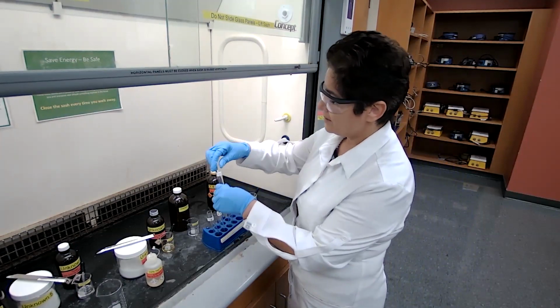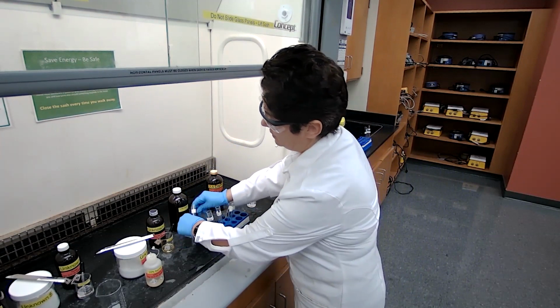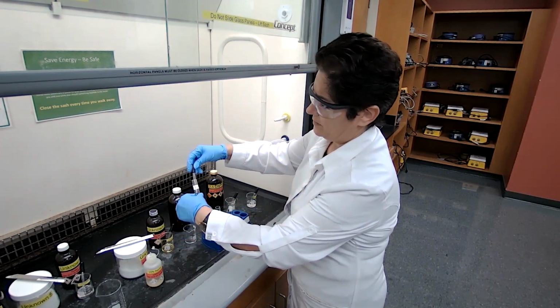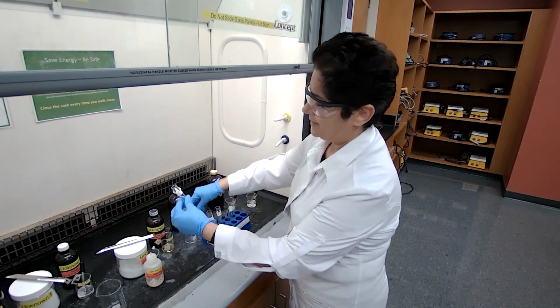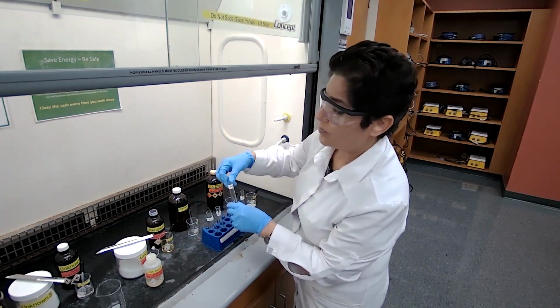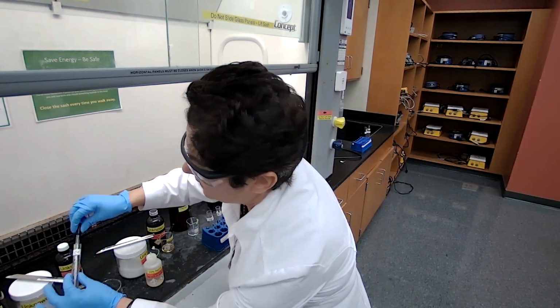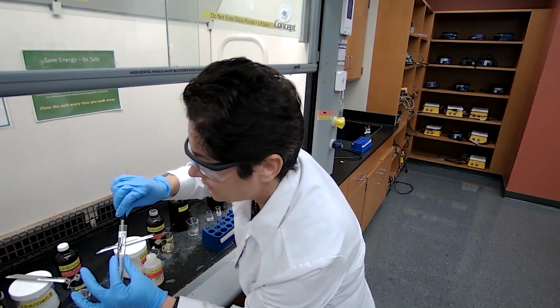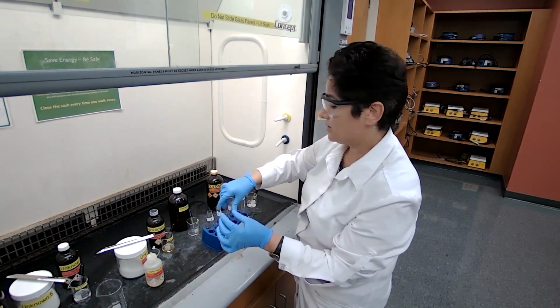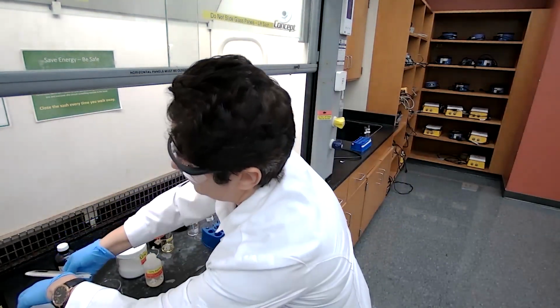And for this test, we are adding, again, 4 drops of the unknown. That's unknown 1, unknown 4. Unknown 5 is solid, so I'm just going to add a tip of a spatula of unknown 5.